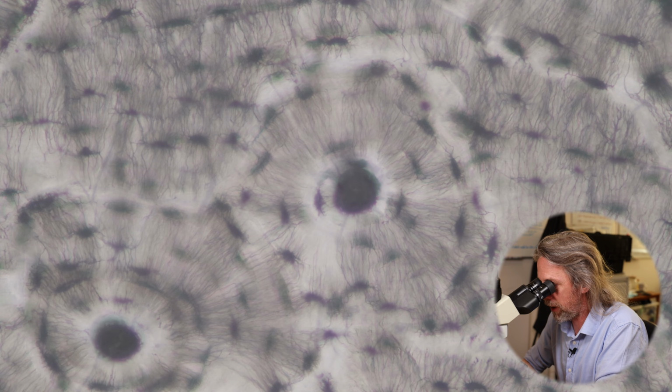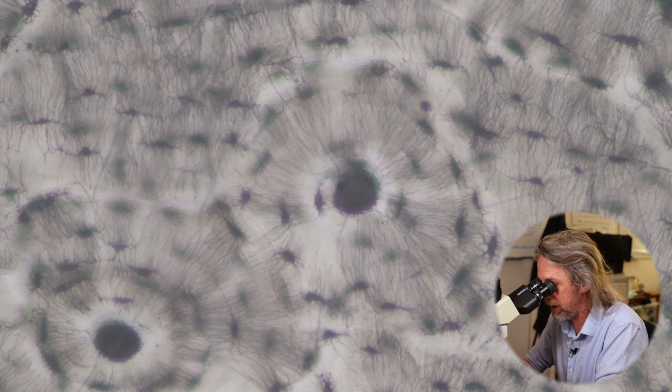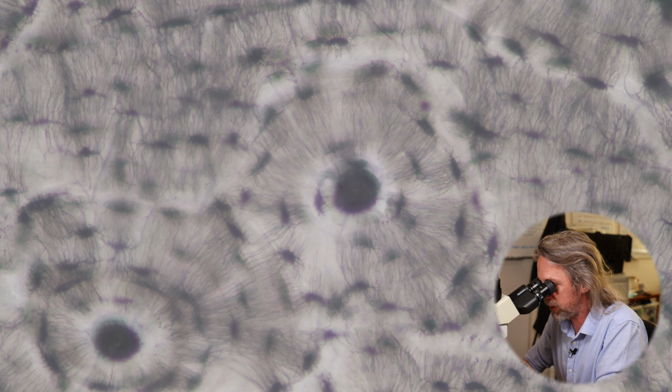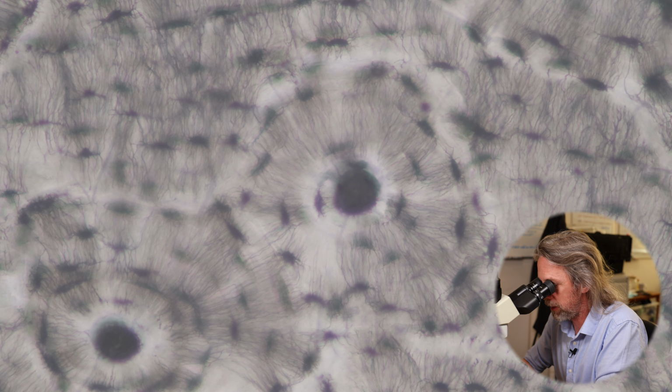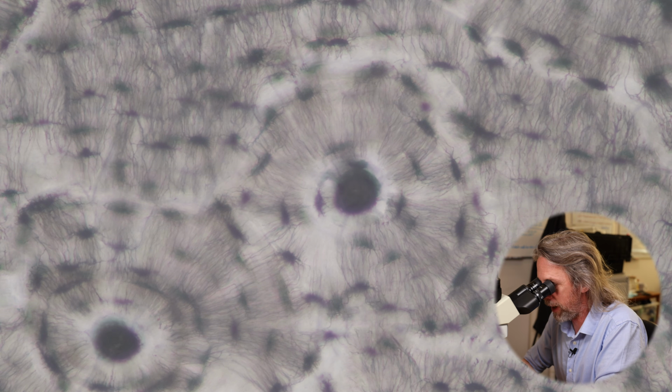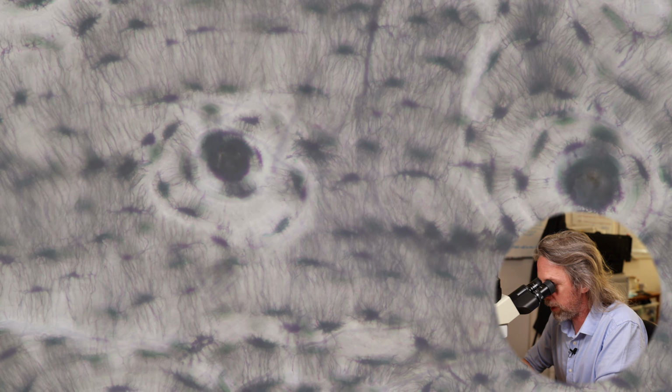And you can see those tiny little processes. Those are cytoplasmic processes of the osteocytes extending in to touch the next osteocyte and the next osteocyte, and then extending in to that central canal. And they can exchange molecules for communication, or for general cellular function and nutrition and that sort of thing. So you can also see how these cells are never very far away from a blood vessel.